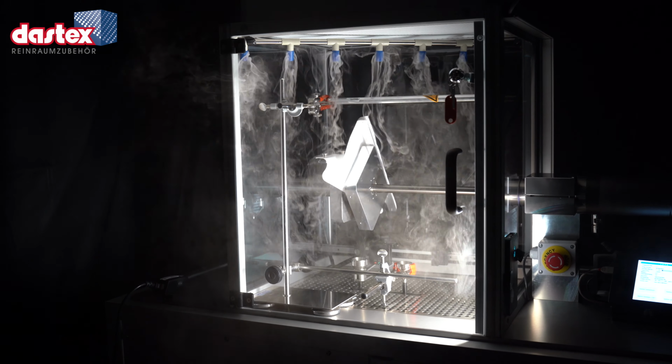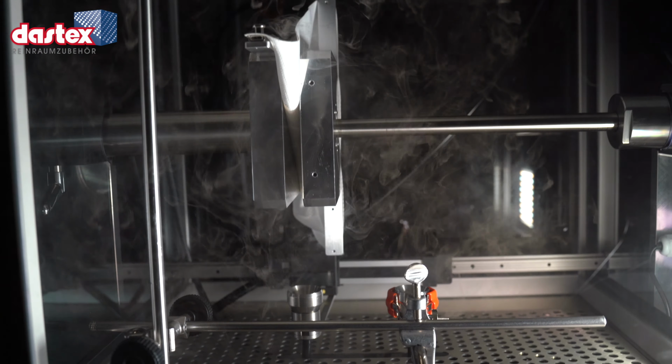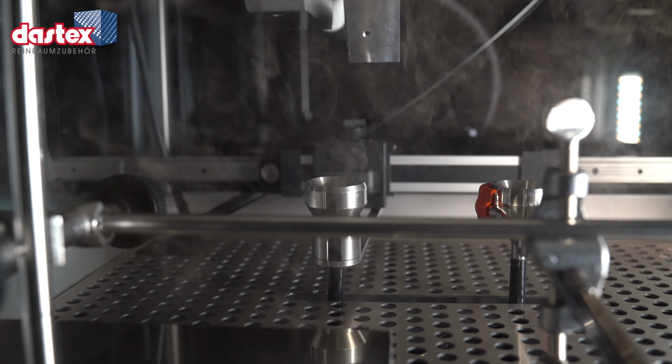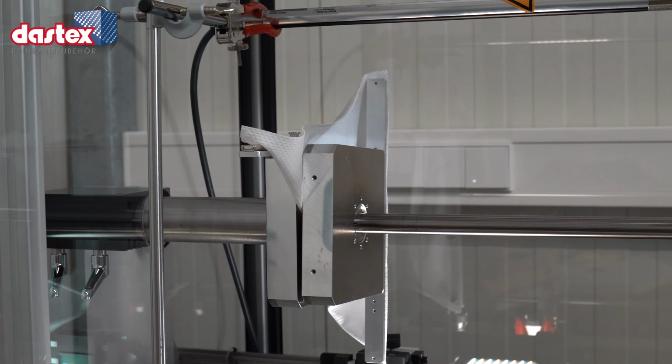In order to obtain meaningful results, other parameters must be taken into account. For example, the measuring time. Statistical aspects must also be taken into account, such as how many repeat measurements with how many samples from how many different production lots must be included, etc.